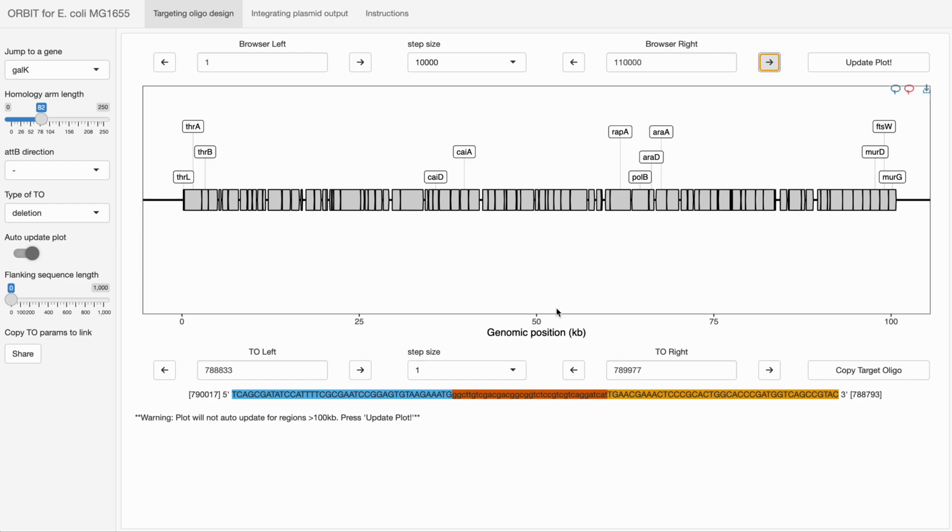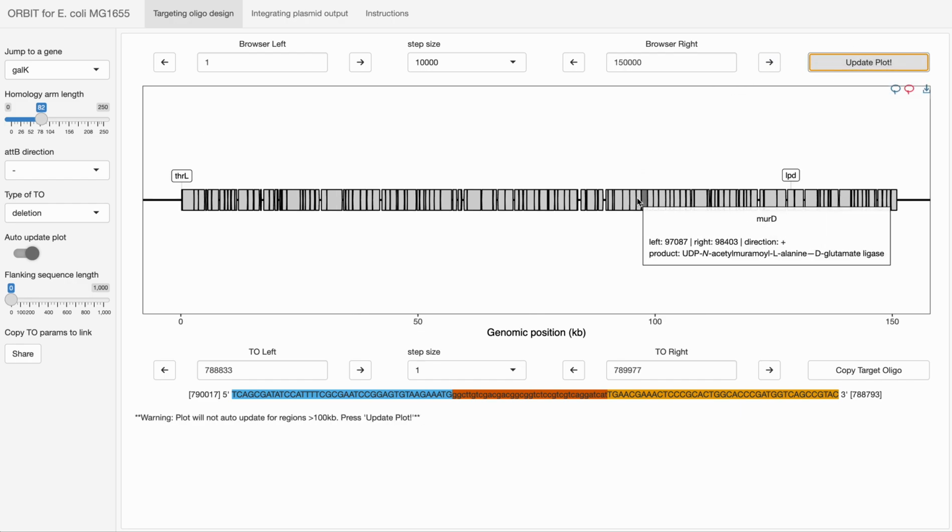so we're going to try to go to 110, we're going to get a warning that the plot will not auto-update for regions this large. We must press update plot. So we can even go bigger, all the way up to 150 kb. It will update if we press update plot. Not very useful, but you can do it.